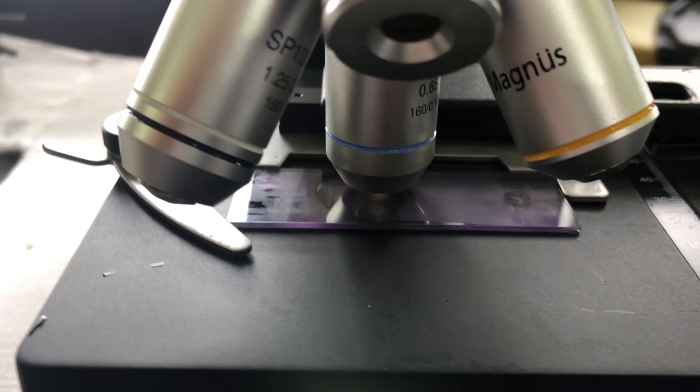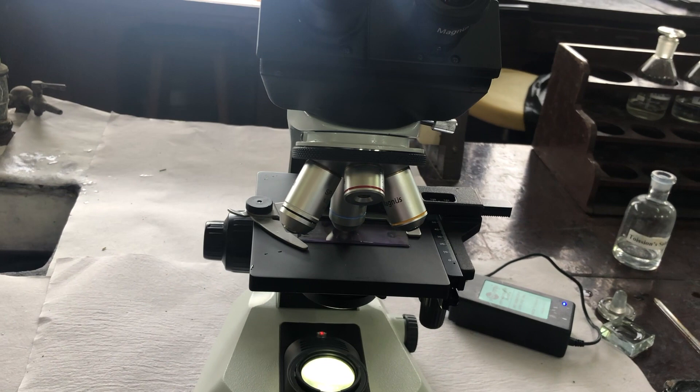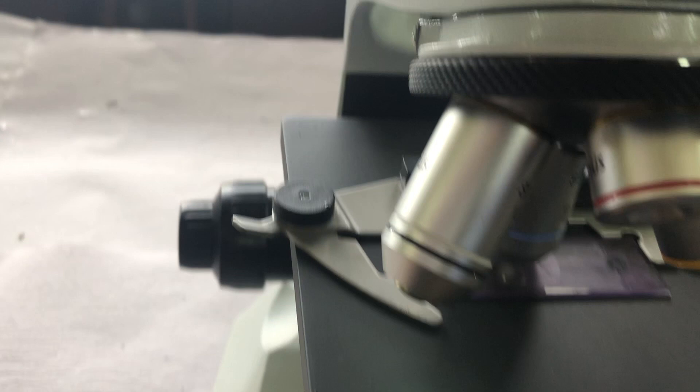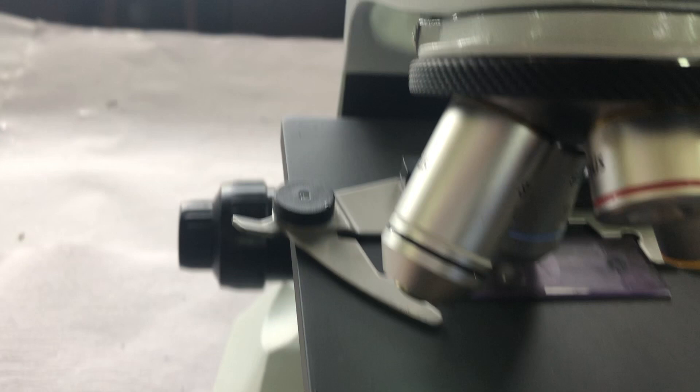For focusing, first use 10x magnification for general focus, and then you would be using 40x magnification for differentiating between various cells. Various cells can be differentiated under 40x or 100x. You can use either of these, but 40x will serve most of your purpose.